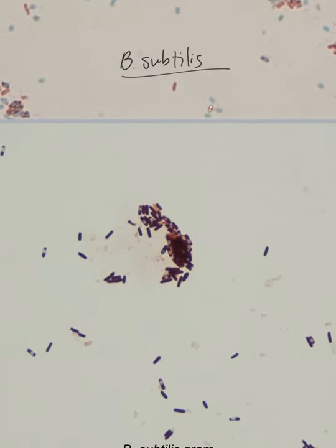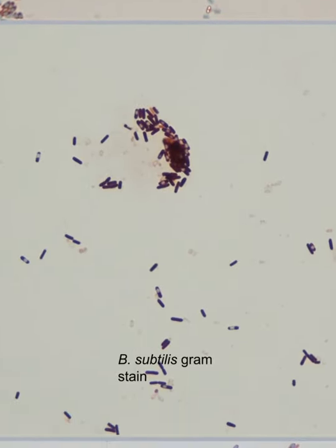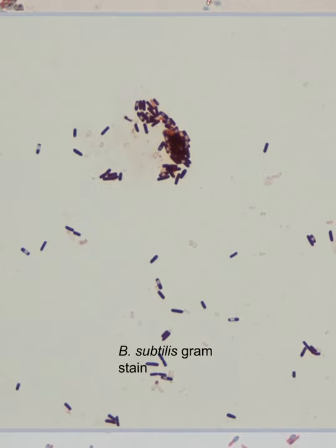What would it look like if we gram stained Bacillus subtilis? I don't think that we usually do that in class. But remember, the reason that we have a spore staining technique is so that we can see those spores better. If we're gram staining, are we using heat? Only to heat fix. That's just very brief. So we're not applying stain and heat together.